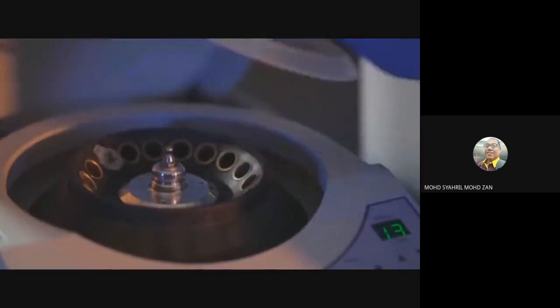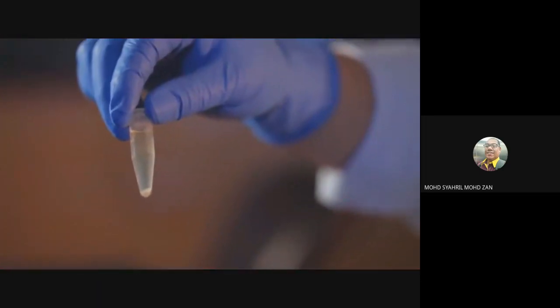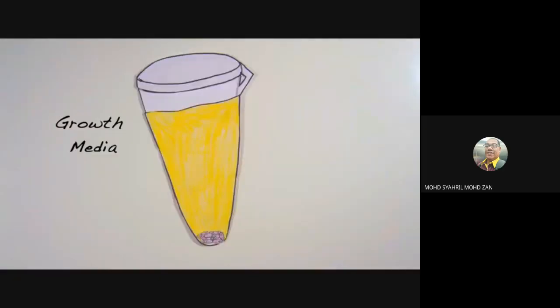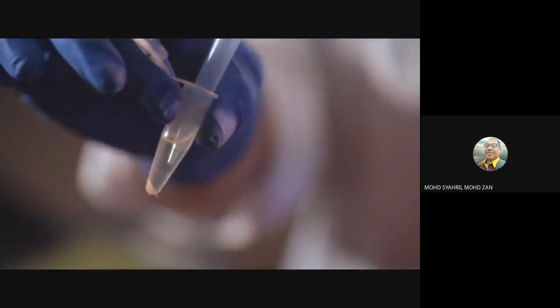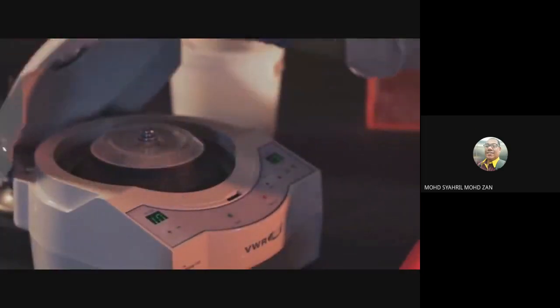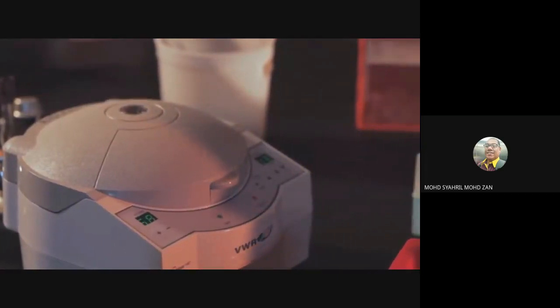At the end of the centrifugation, a small pellet will be at the bottom of the tube. This is made up of the bacterial cells that contain the plasmid DNA you want. The clear liquid supernatant is LB, the bacterial growth media, with an antibiotic such as ampicillin. Remove all traces of growth medium by pipetting or pouring out and discarding the supernatant. Don't worry, the pellet will not move as long as you don't touch it. In some cases, you may want to spin down an additional 1.5 milliliters of bacterial culture in the same tube to increase plasmid DNA yield.